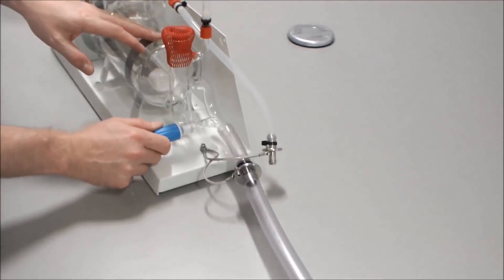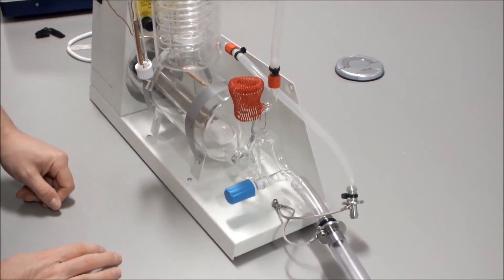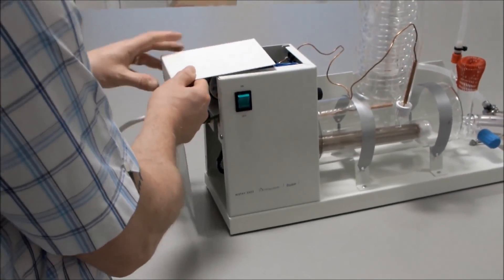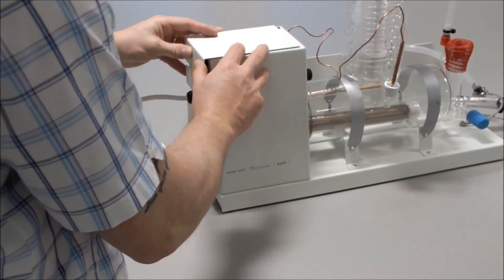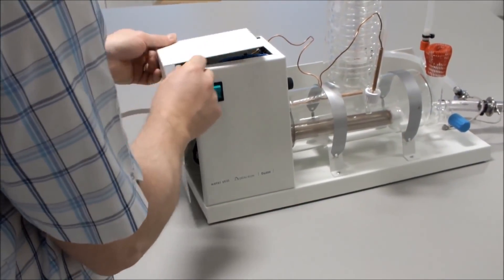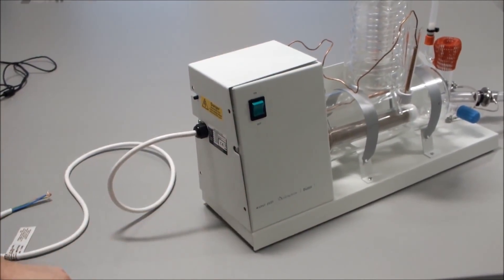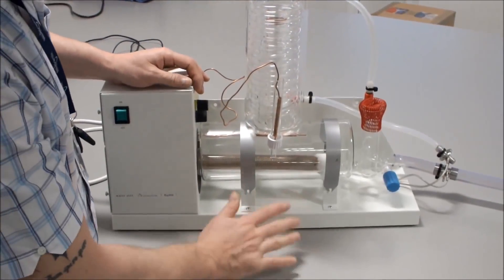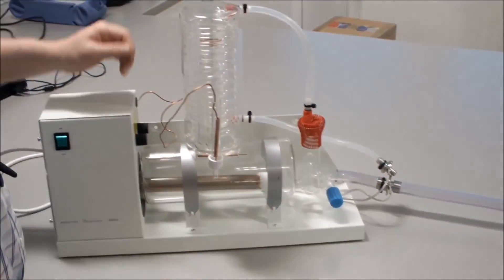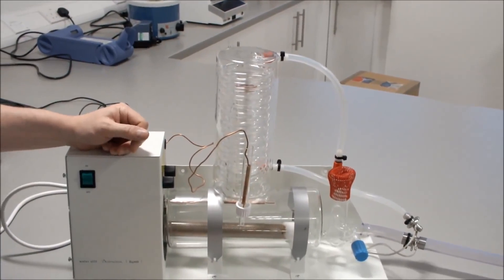It is important to ensure the stopcock on the front is fully closed. The final thing is to connect back the end panel and tighten the four screws. The Distinction is connected up. Ensure you have good quality tubing held with hose clips for your cold water supply. Allow the water to feed through, ensure your stopcock is closed, and check for any leaks. Then turn your water supply off.